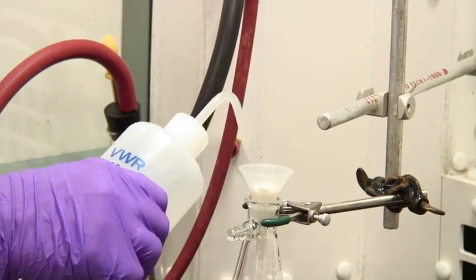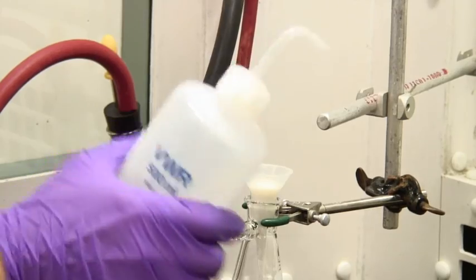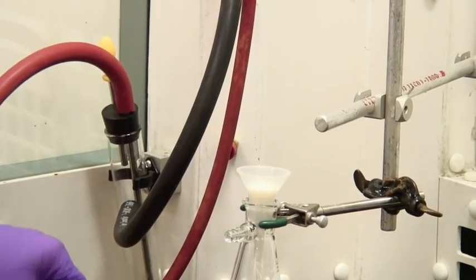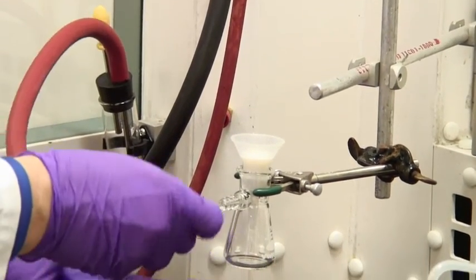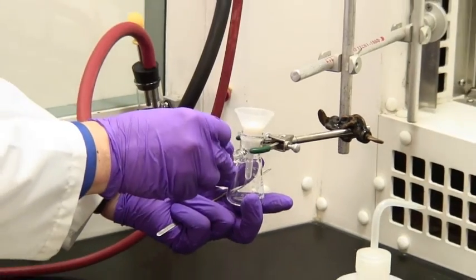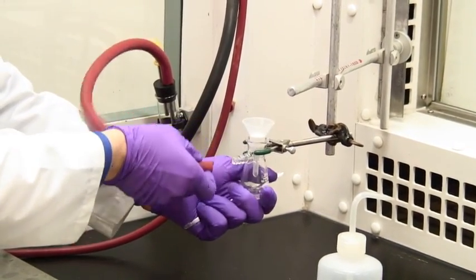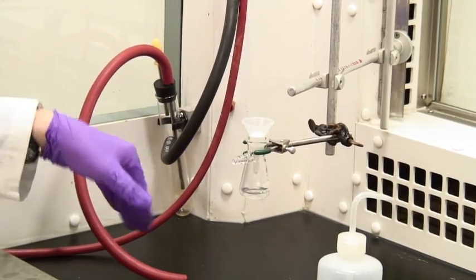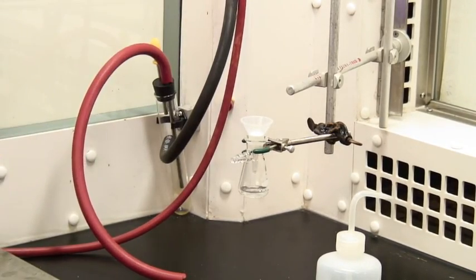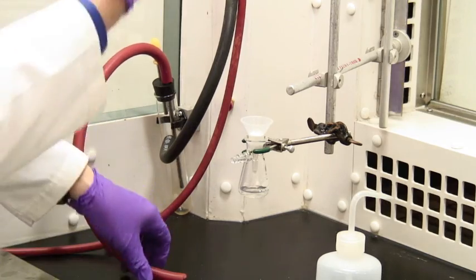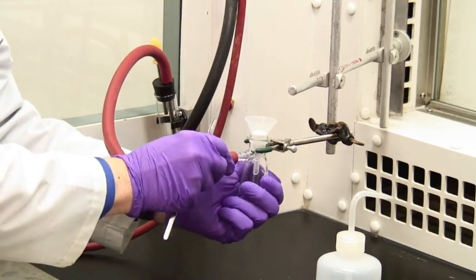Then apply just a little bit of a vacuum. You're not trying to dry it. All you do is apply vacuum so that you cause the filter aid to sit and form a nice bed.